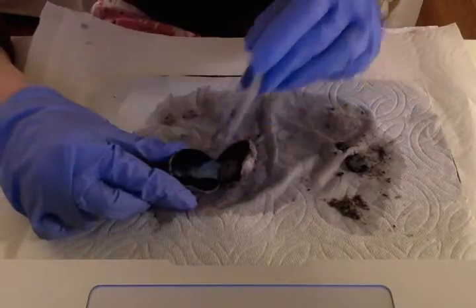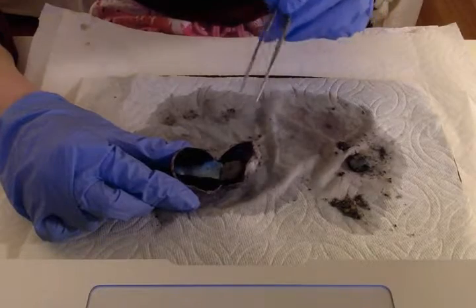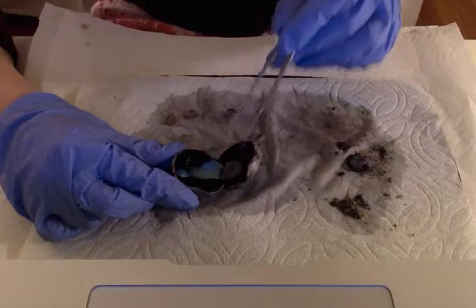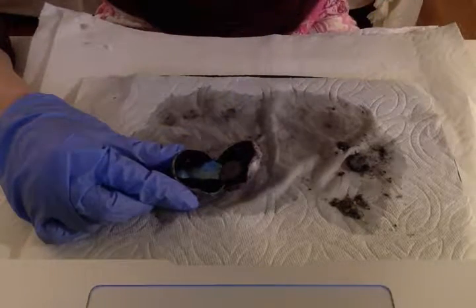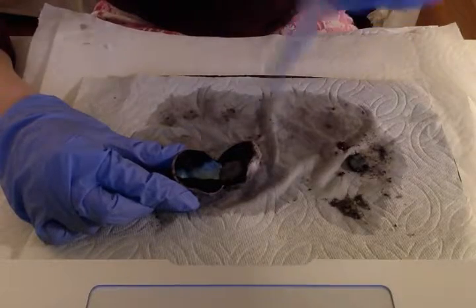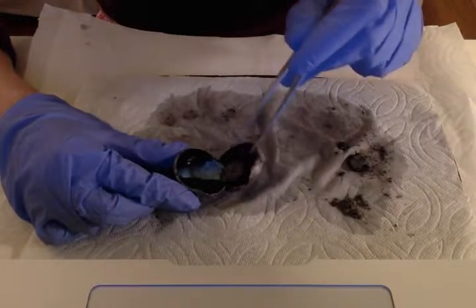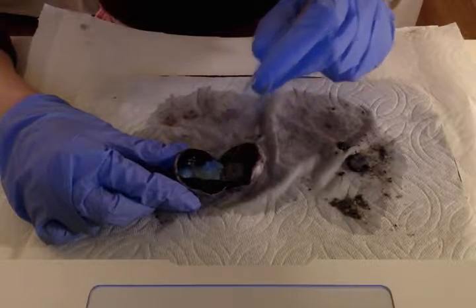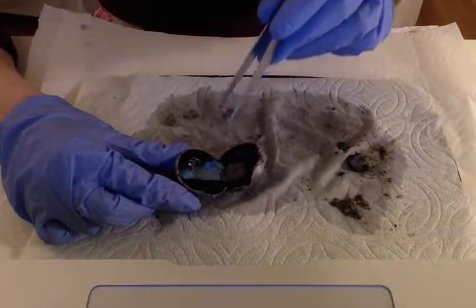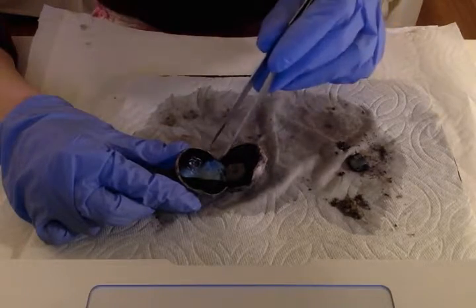Okay, so now to the retina, which is in the posterior portion of the eye. Now, the retina is a layer in the posterior area of the eye that contains photoreceptors. Photoreceptors are very important because they are the specialized neurons that receive light energy from the environment, and then they convert this energy into electrical signals that are sent to the brain for interpretation. So we have two types of photoreceptors. We have cone cells and we have rod cells. Cone cells detect colors. Rod cells are used for night vision.